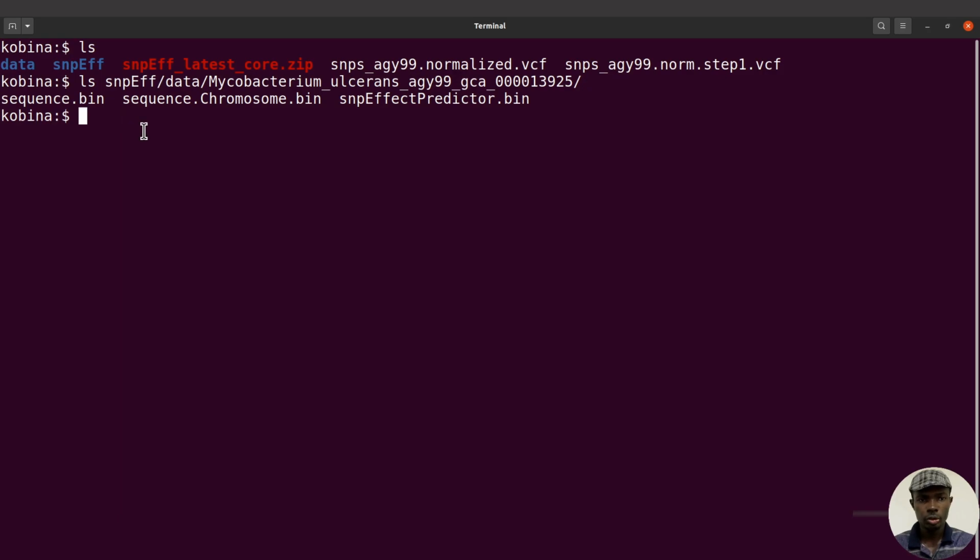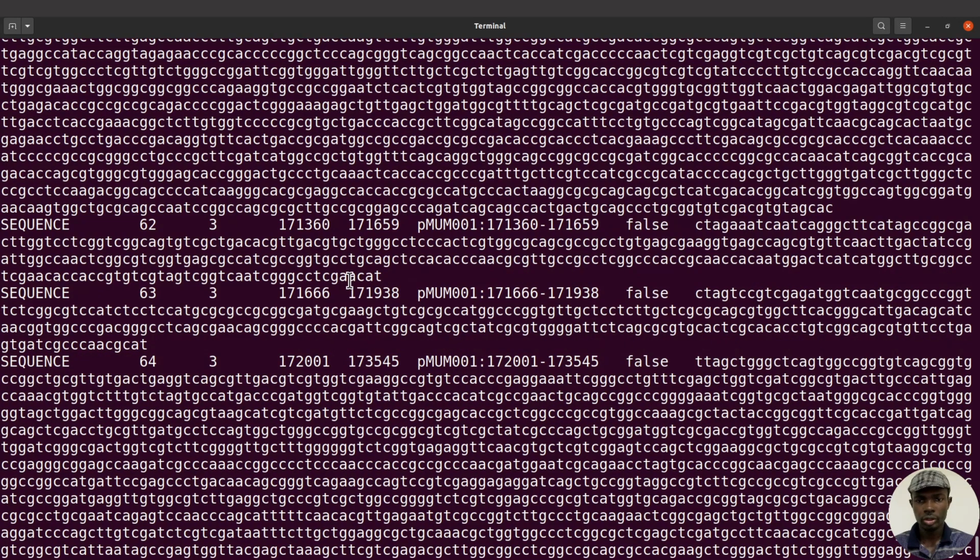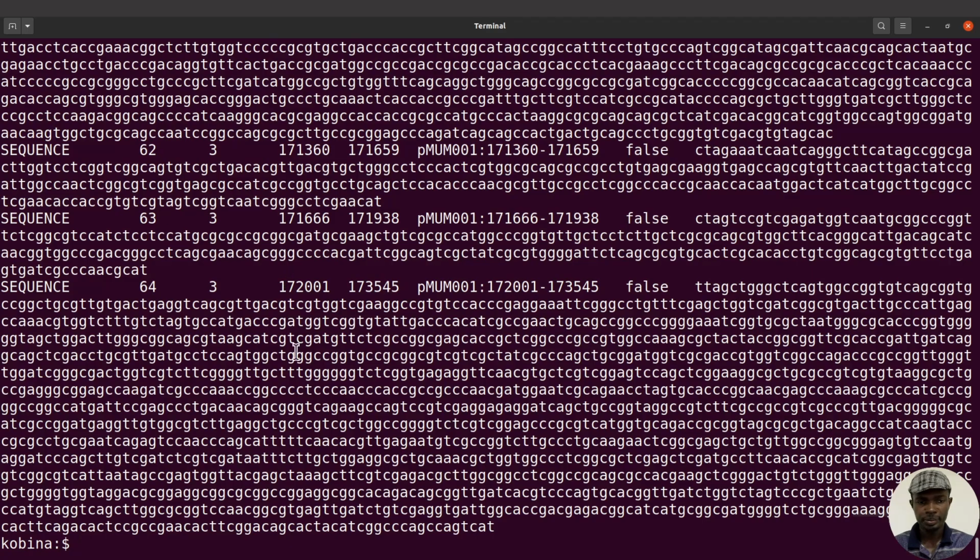So I'll need to display the content. To do that, I'll say zcat, and then snpeff/data/ this /sequence.bin. So let's execute this command. This will give us some information. With the information, just look at the last few lines here, and then look at this one, for example. All right, so we have the information here.